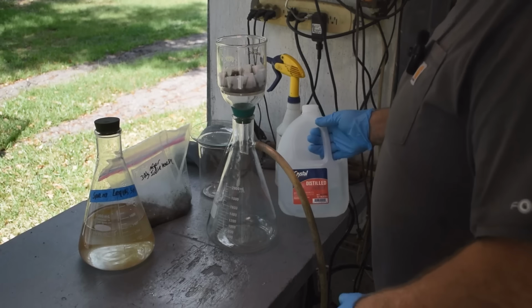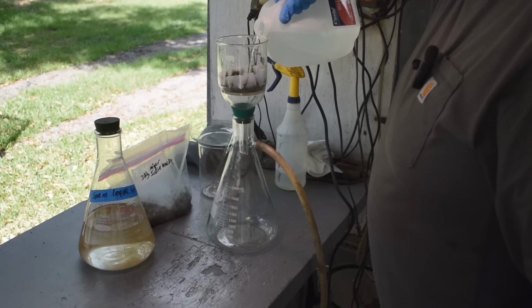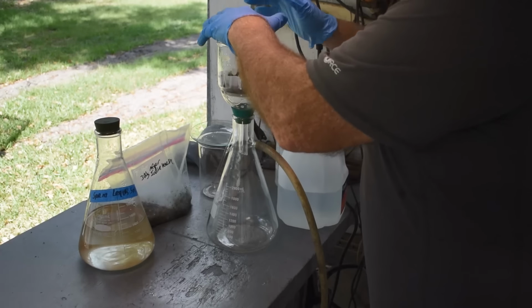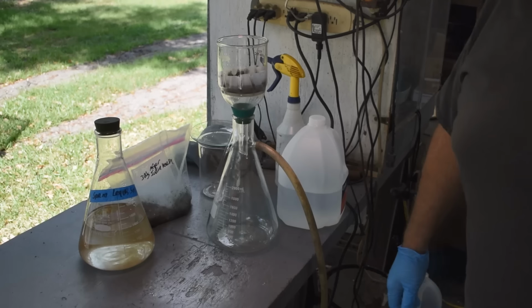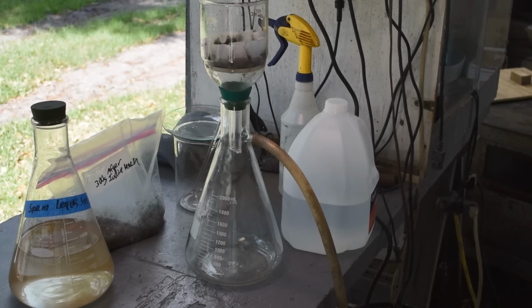Let me run some distilled water across the mud up here, or through it I should say, to try and pull the remains of the leach out of it so that we don't have to fight it when we're trying to reprecipitate the gold out of solution later. So I want to get as much of the iodine compounds out of it as I can, so we'll just let that run through there, and I'll probably give it a couple additions of distilled water and suck it through the mud with the vacuum and hopefully take iodine compounds out with it. Then we'll be ready to move on to the next step.